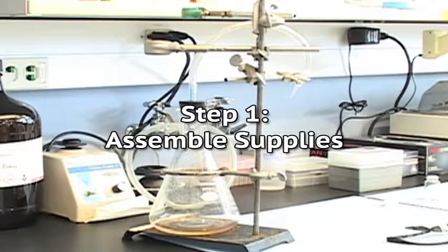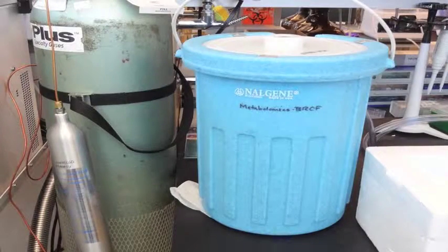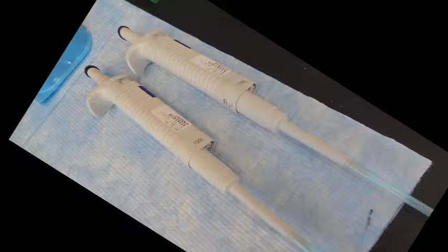These items include: a vacuum aspirator to remove media and rinse, preferably with tip held by a clamp to allow free hand access; liquid nitrogen in a small hand-held dewar to rapidly freeze the cells; dry ice in a cooler to cool the plates after the liquid nitrogen quench; and a dispenser top, bottle, or pipette ready for rapid dispensing of rinse solution, as well as a rinse buffer.